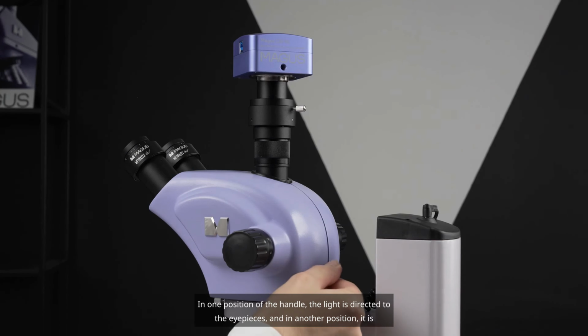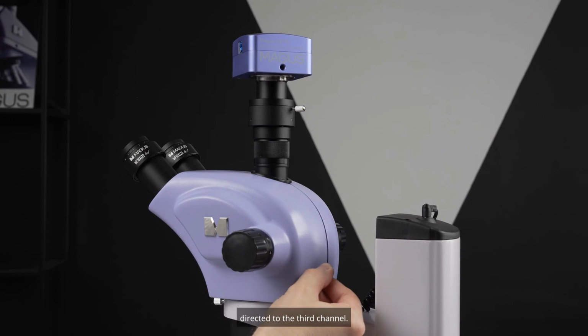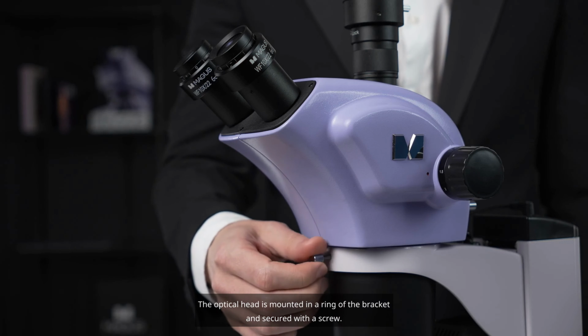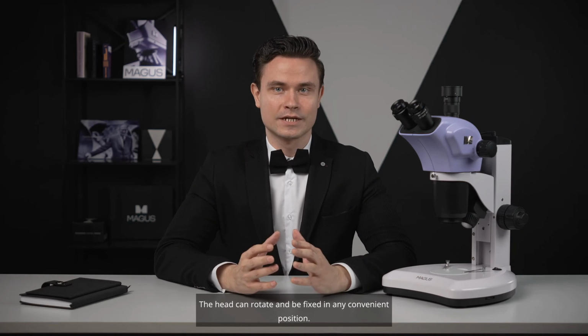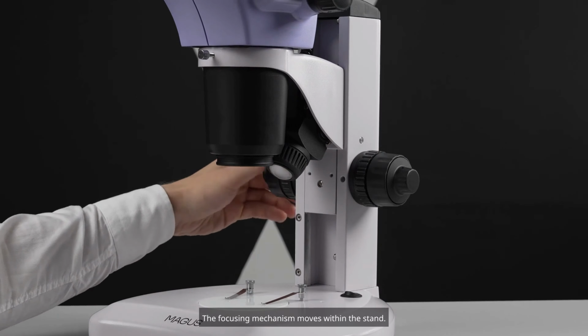In one position of the handle, the light is directed to the eyepieces, and in another position it is directed to the third channel. The optical head is mounted in a ring of the bracket and secured with a screw. The head can rotate and be fixed in any convenient position. The bracket is attached to the focusing mechanism. The focusing mechanism moves within the stand.